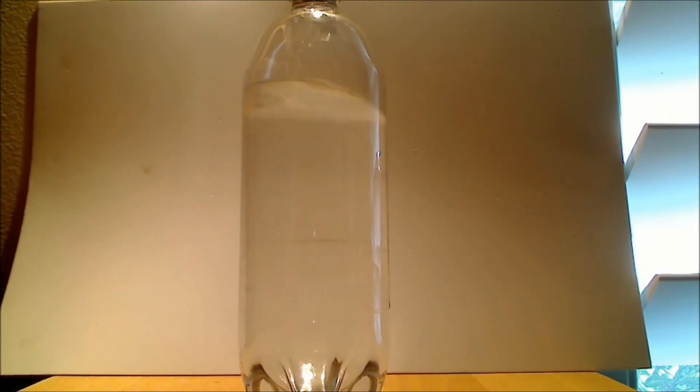And if I shake it a little bit, you can see it wobbling around. Now to make that boundary a little more apparent, I'm going to add some dye to this mixture. I'm going to add green dye.